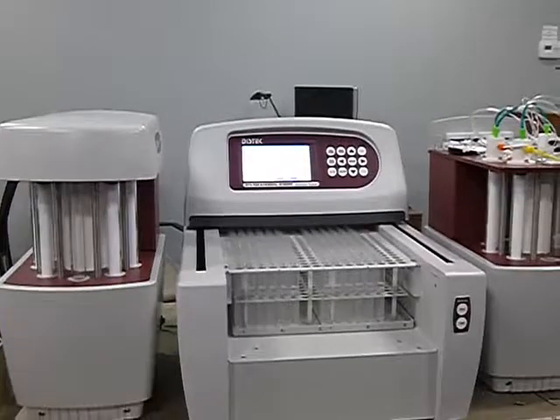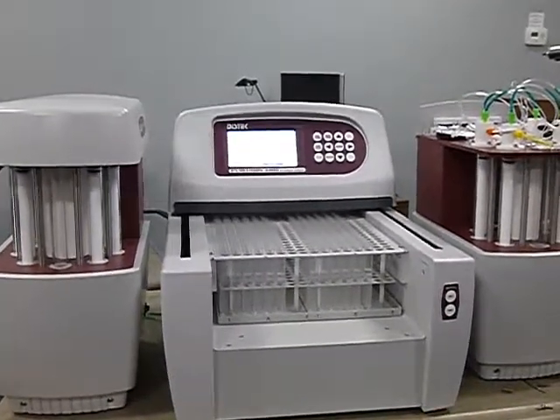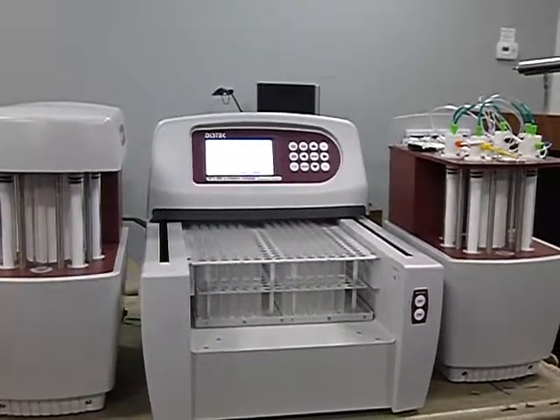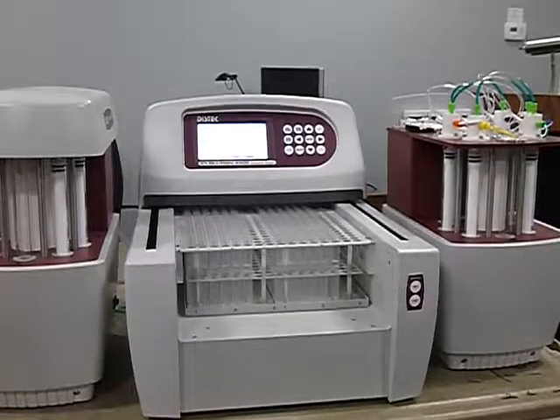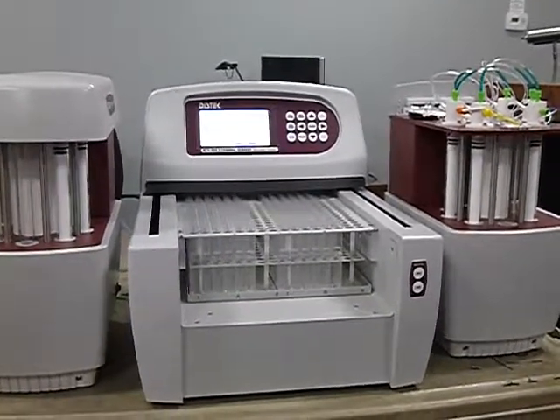You have to make it for side A and side B. But what's nice is the customers that don't care for pH will NA that. So there's 45 minutes of calculations I can start doing. I'm sitting there with my binder, filling in the numbers, doing all the calculations of the previous runs, or putting in their weight tapes.